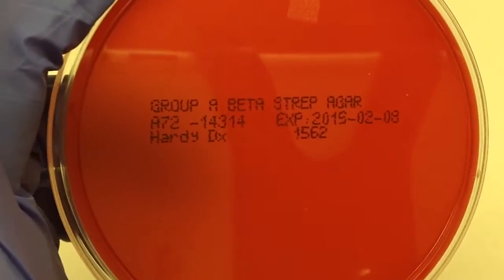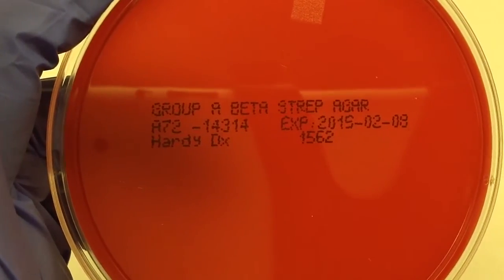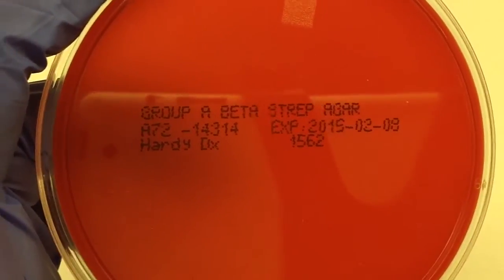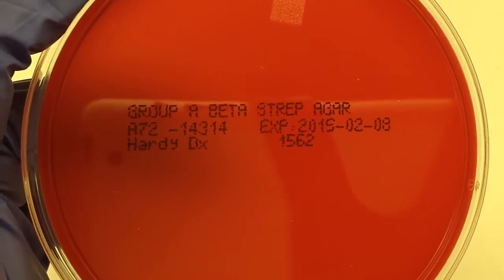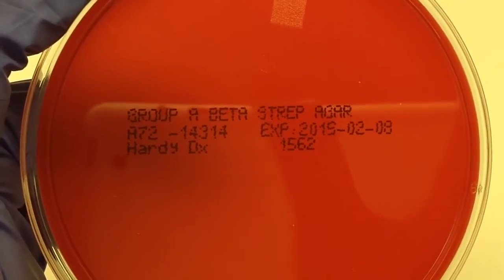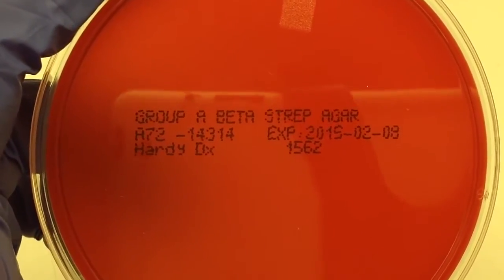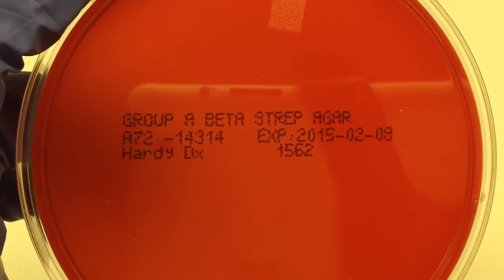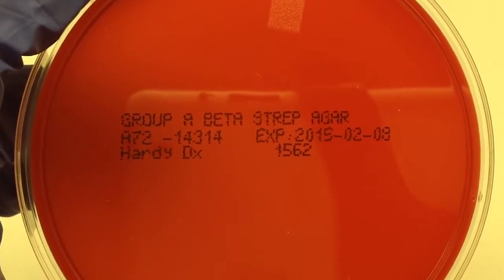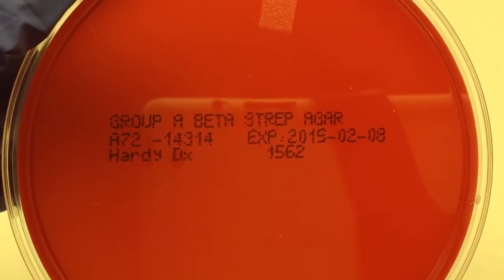This is a group A beta strep agar. This is used for throat cultures. This will suppress other gram-positives besides streps — for example, it will suppress staphylococci. Its specific purpose is to find group A beta strep.